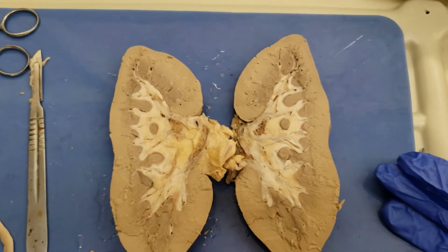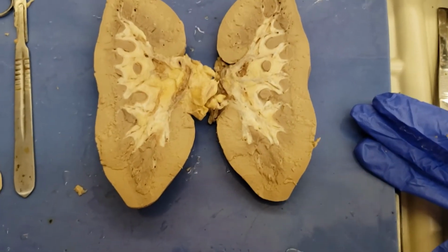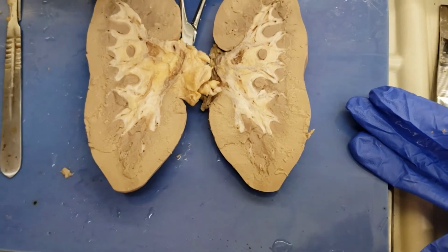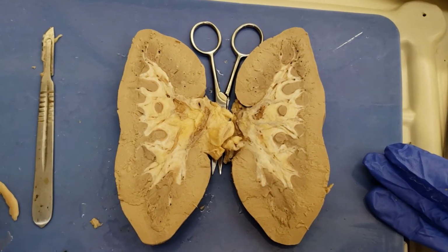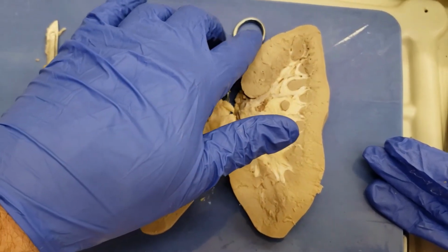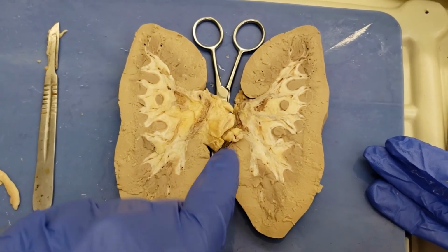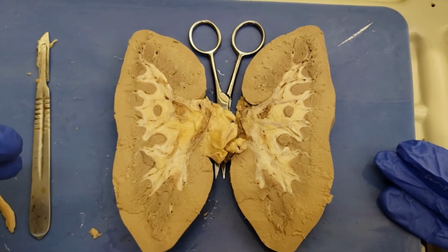It kind of looks like a weird demented butterfly now that I'm looking at it at this angle through the camera. It gives me a whole new perspective. We're just missing a head. Let's see if we can find something that'll serve as a makeshift head. Oh, I know. These scissors will work. And there's our cute little butterfly of a kidney. I think that's kind of cool. There's the little antenna eye things. That's two different structures. And then that's part of the body. Little tail thing. And then the wings, which is all I really care about with the butterfly anyway. Kidney butterfly.